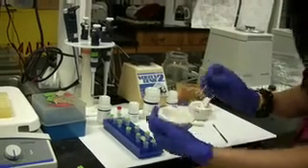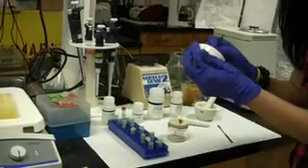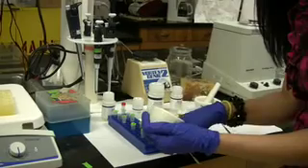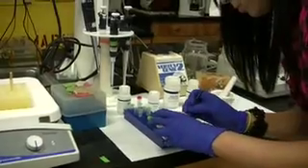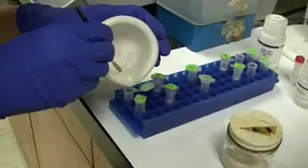All the tissue is broken down now, so you're going to scrape it with the spatula. And once you have it all, you can go ahead and pour it in here slowly. This is all the tissue broken down.